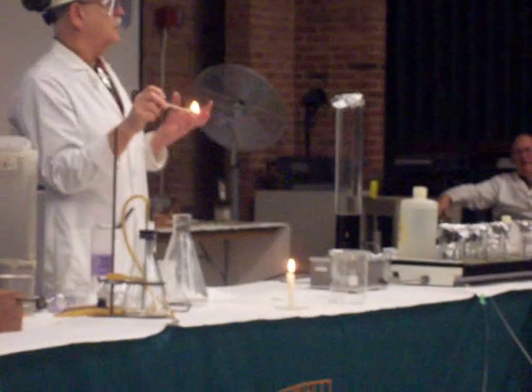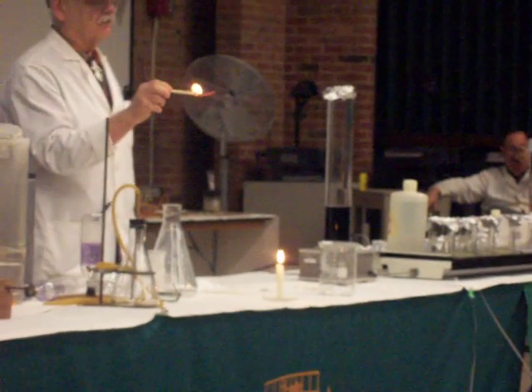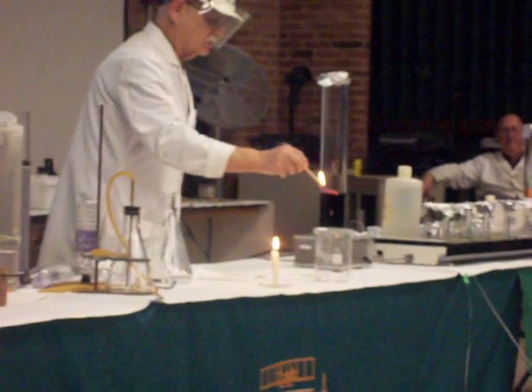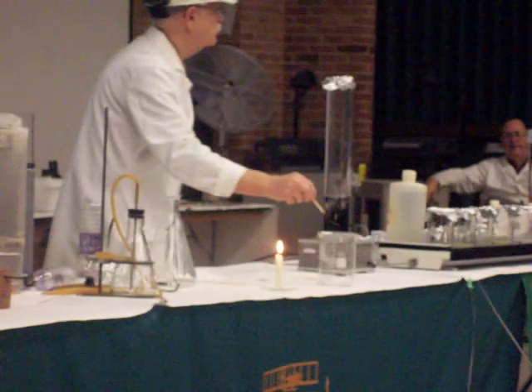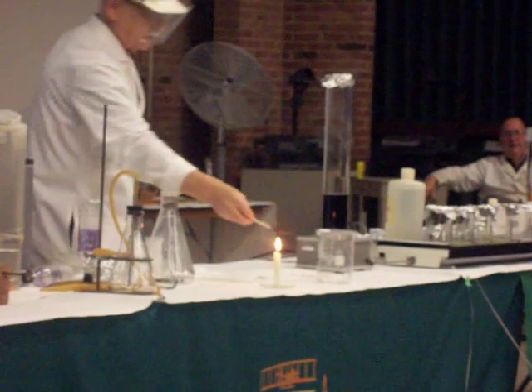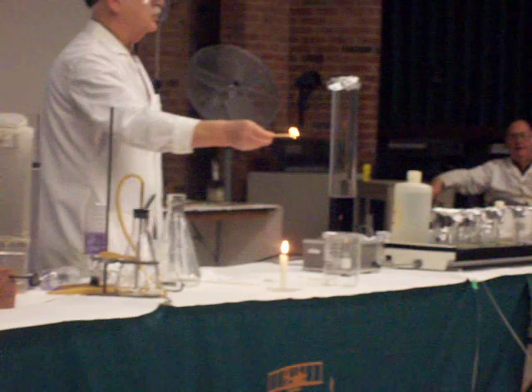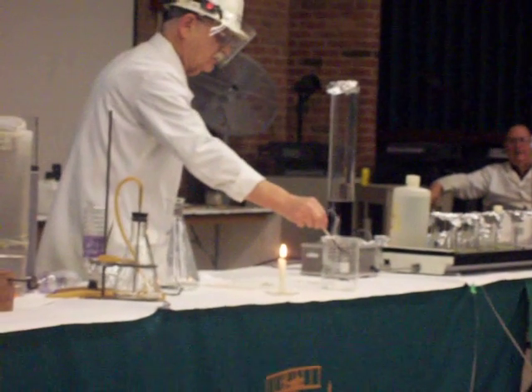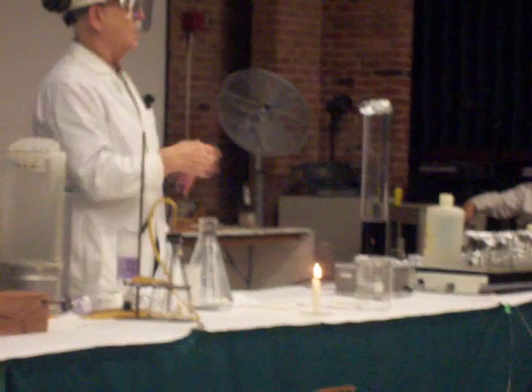Carbon dioxide gas is colorless. It's also heavier than air, and in general it will not support combustion. So I can do a chemical test here by putting the ignited splint into the beaker. It goes out at the very top of the beaker — so although you can't see the carbon dioxide, it actually fills that beaker to the very top.